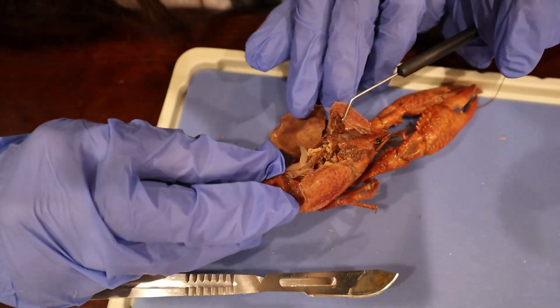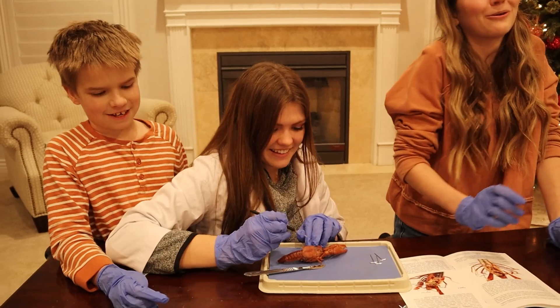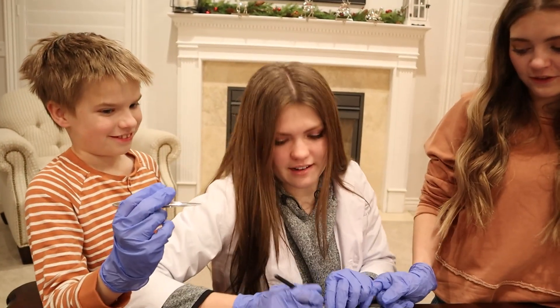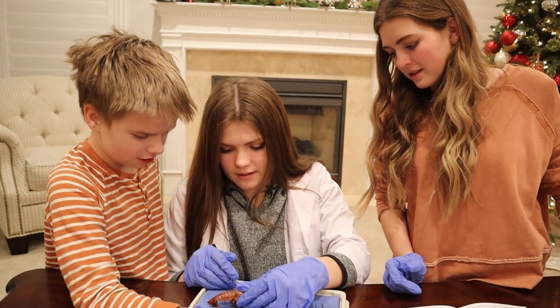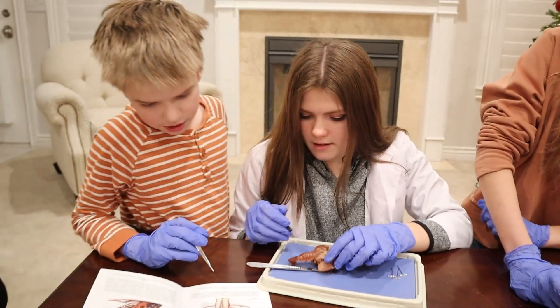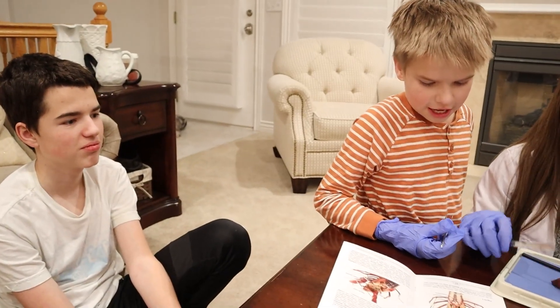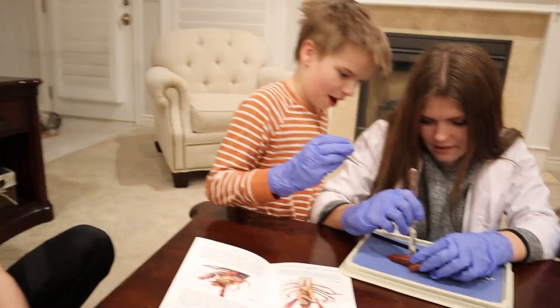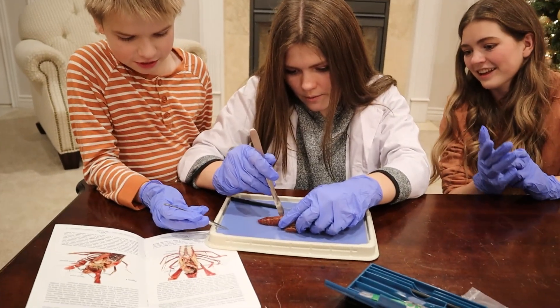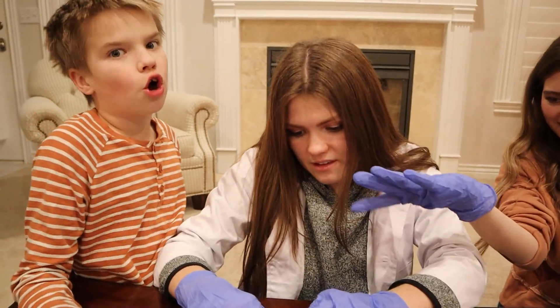Well, this is the gills. What is this raisin that I'm poking? Probably his brain. I just touched my flap — I'm cringing so hardcore. You didn't even touch it. Do you want to pop out the eyeballs? No! I'm grateful for this crawfish. We should get something out onto here. So what's what in there? This is the gills — that little flap. My tummy hurts. We're not getting that out. This is not for the weak. We should probably get the stomach. Jake is just over there. I'm not I don't like how it gets closer and closer.